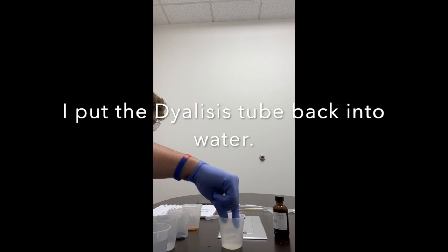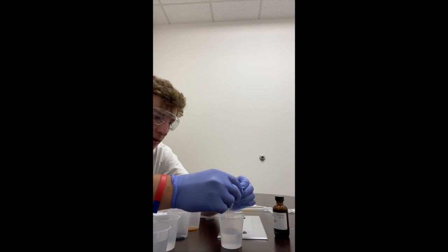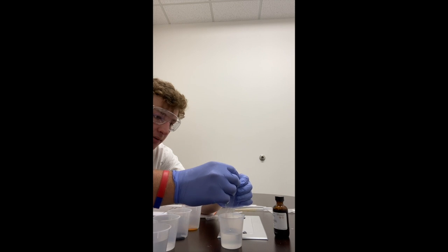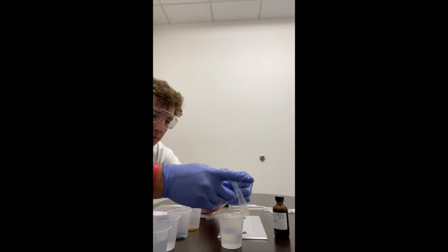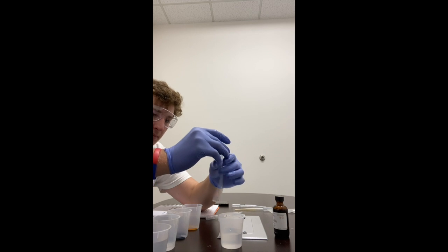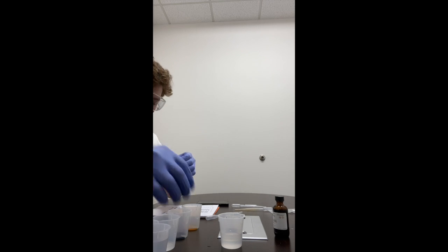So we're going to try the dialysis tube again. We're going to remove it from the water. And there you go, it opened up. So it is open. So we will take one side and fold it over 3 centimeters, fold it again, and we'll make the tube stoppage again.